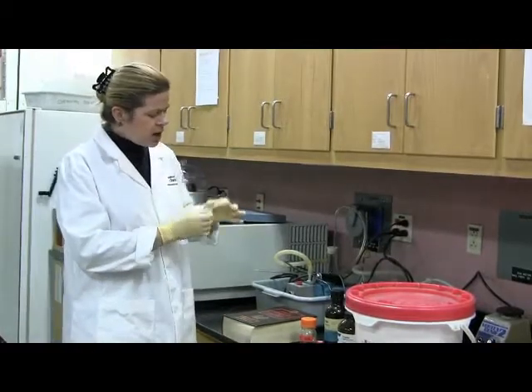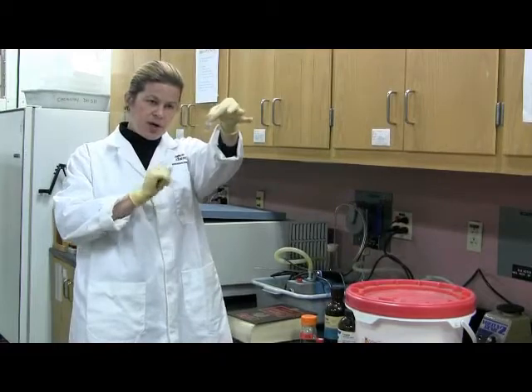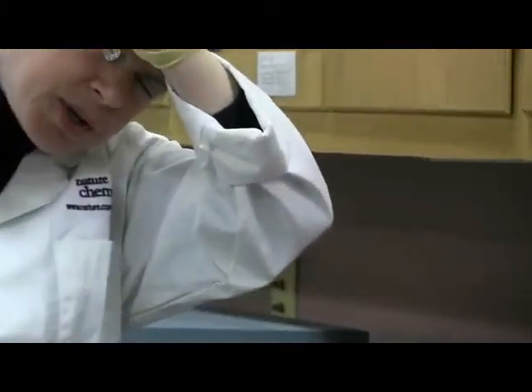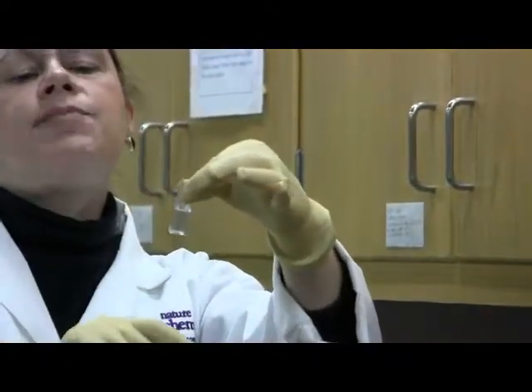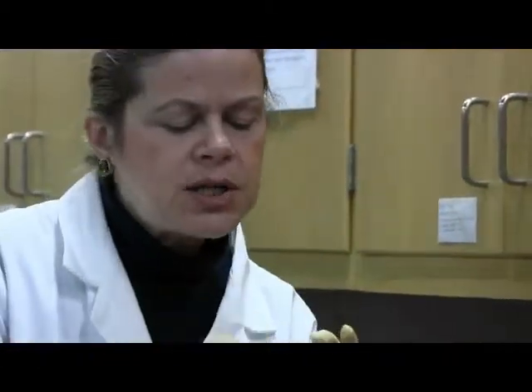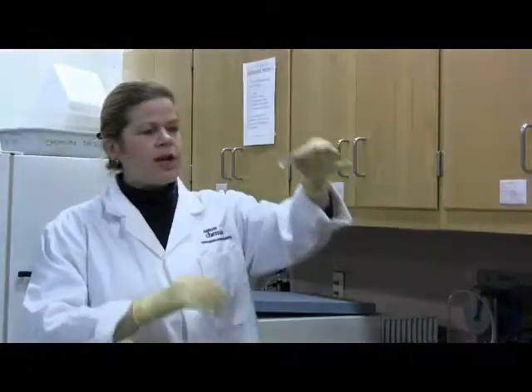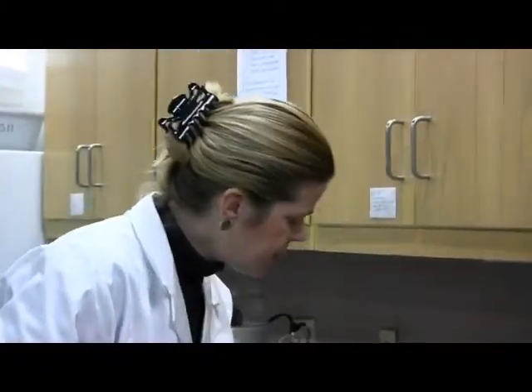This cuvette, by the way, you want to use the semi-micro cuvettes in the spectrophotometer. They have one perfectly optically clear side, crystal clear through one side, and the other side is not optically clear. So you want to make sure that you put it into the spectrophotometer with the optically clear side through the light path. Okay. We also have these cuvettes that have 4 optically clear sides. Those are fluorimeter cuvettes. Don't use these in the spectrophotometer.